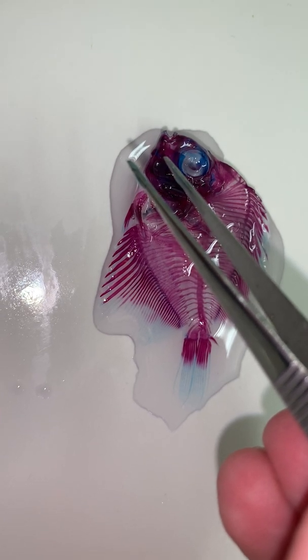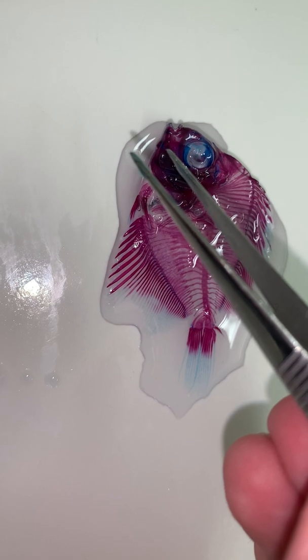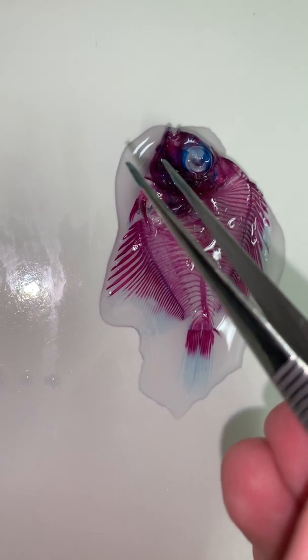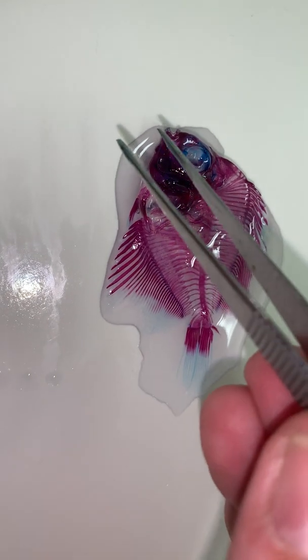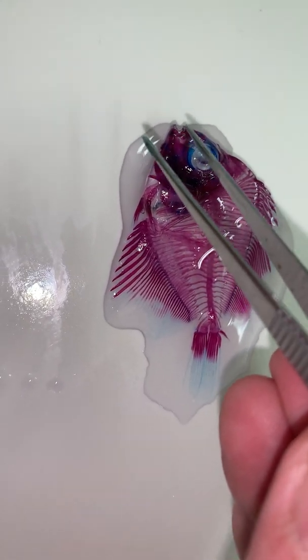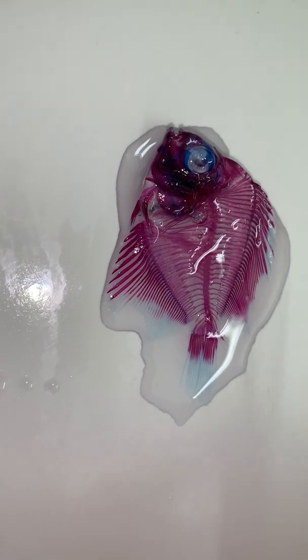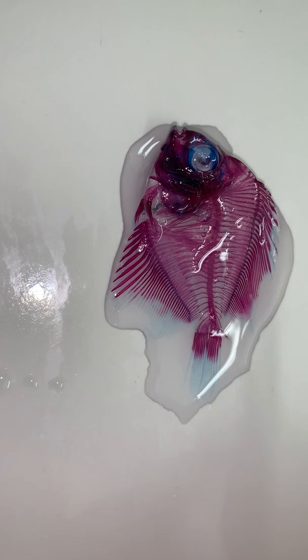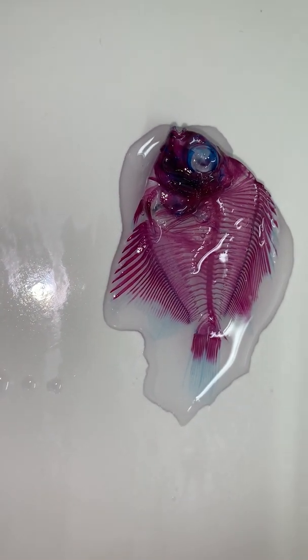That is the articular bone. And the articular bone is an endochondral bone. And it is not fully developed. But most of the rest of the jaw bones, especially the dentary, which is the one with the teeth on it, and the premaxilla, which is the other upper jaw bone with the teeth on it, those are fully red because they're intramembranous bones, so they never have any cartilage associated with them.